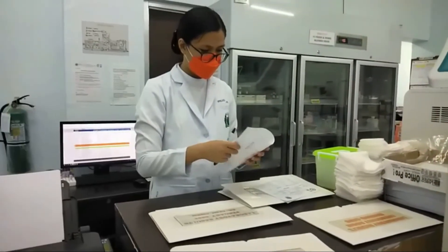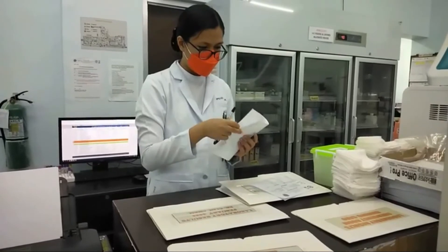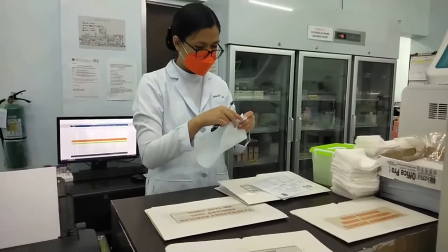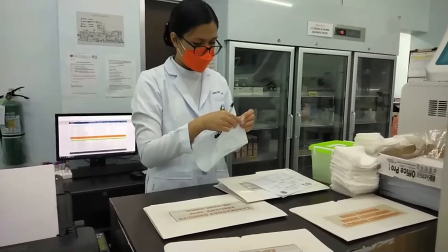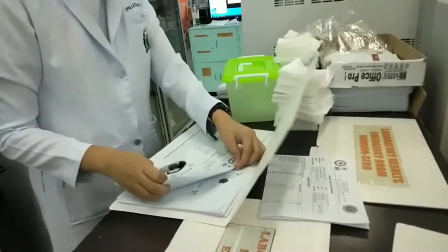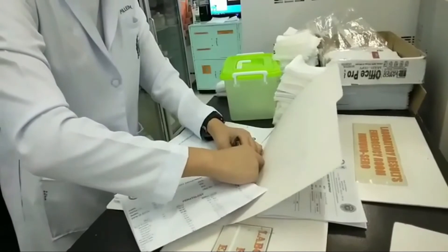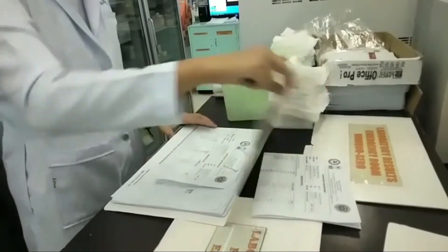Manual logging of the patient's name and tests performed on different ward folders is completed for laboratory document purposes. Thank you.